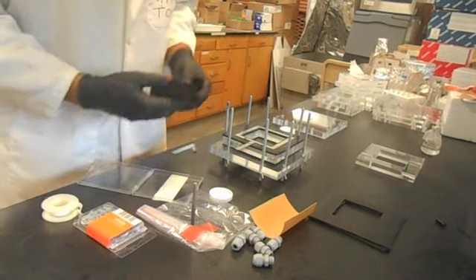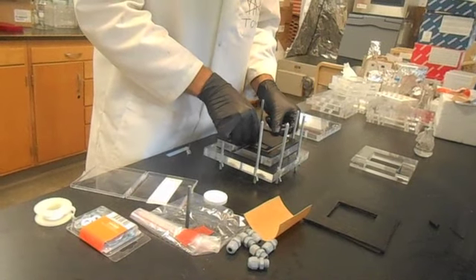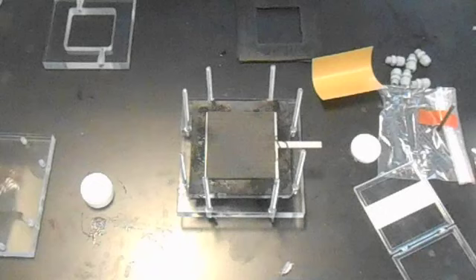Next, place the carbon felt cathode in the center of the cell so the edges make contact with the current collector. Try to maximize the surface that comes into contact with the collector to ensure equal charge distribution when a current is applied. Here is the top view of the cathode half cell thus far. Here is a side view of the cathode half cell thus far.